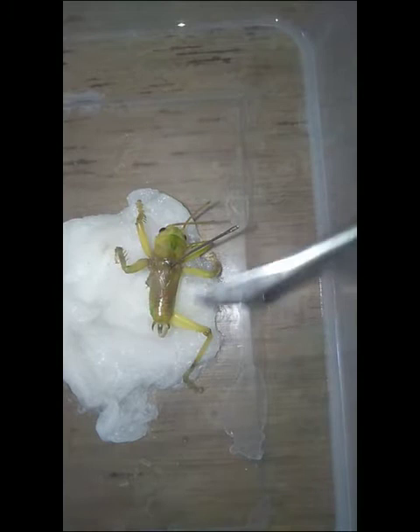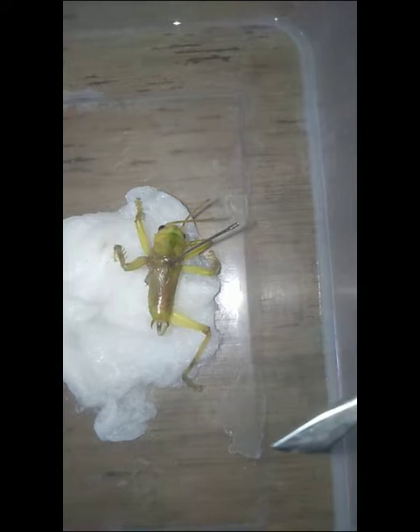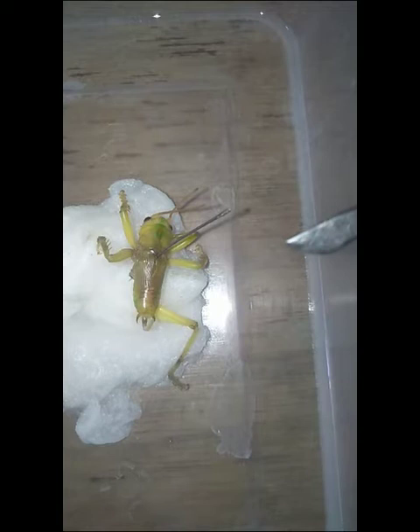The body of a grasshopper is narrow, elongated, tubular, and somewhat compressed laterally. The body color is yellowish and gray, which enables them to resemble the environment in which they live. The entire body is covered by a hard cuticle or integument, which is divided into a definite number of segments.